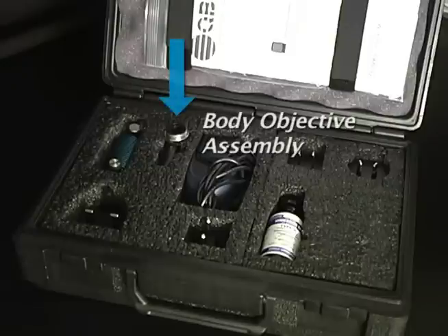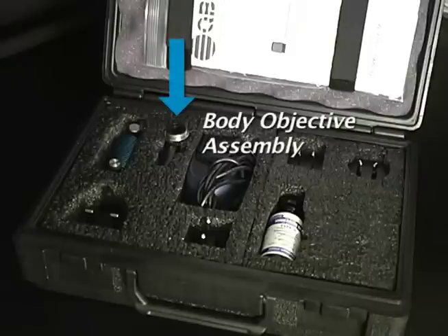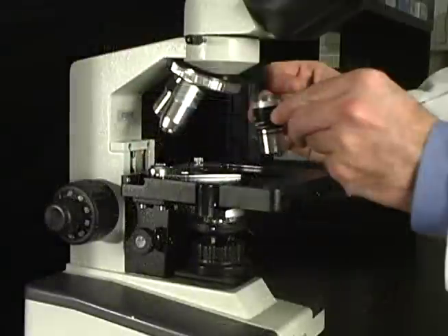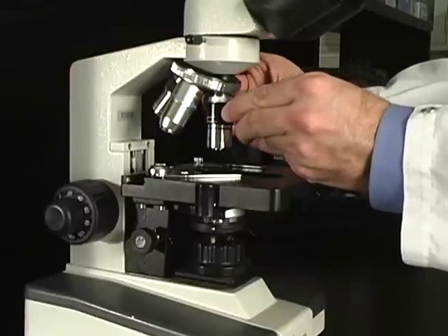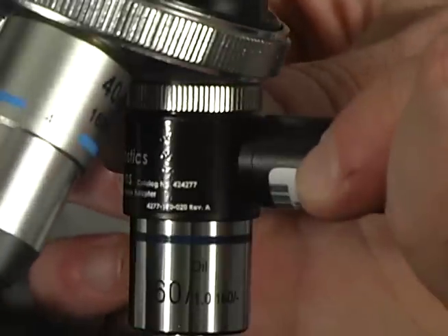To begin, let's look at the components that are included with the Paralens. The body objective assembly houses the technical components of the Paralens and attaches directly to the microscope nosepiece by way of standardized RMS threading.